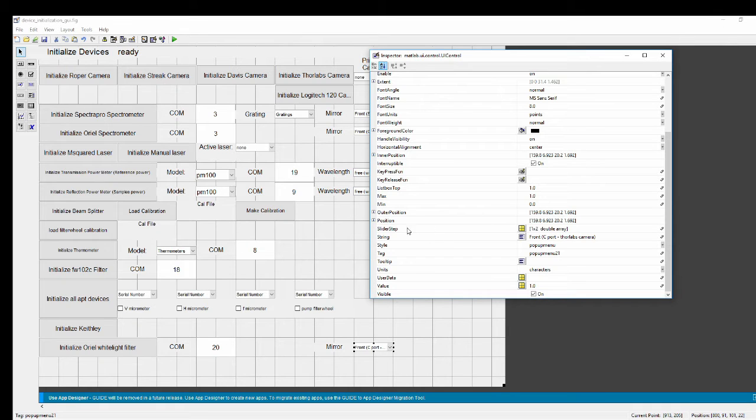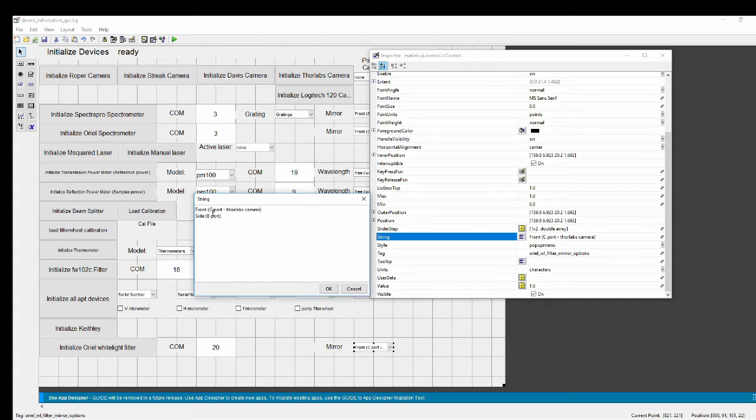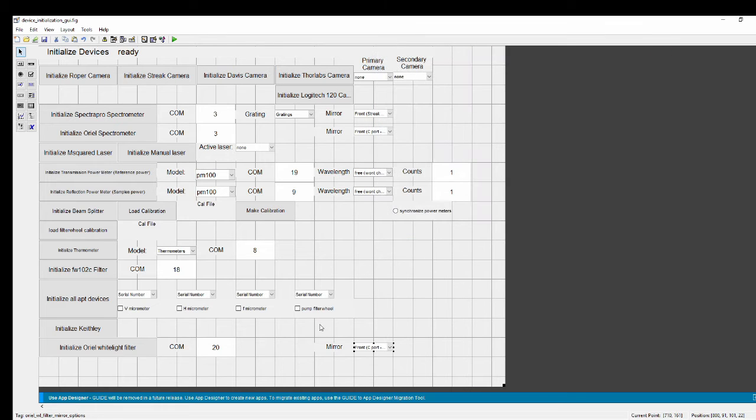And lastly, the drop down to select which exit mirror is being utilized. Which I seem to have called, is it option or options? Hold on, can't read my notes. It's options. Okay. Now in this case, the strings are already set. We know that the C port is the Thorlabs camera and the B port is the side. And I guess maybe I could put in something like white light filtering, since this is going to be used as the input to another spectrometer. Okay, all of that looks pretty good. Let me check my notes.